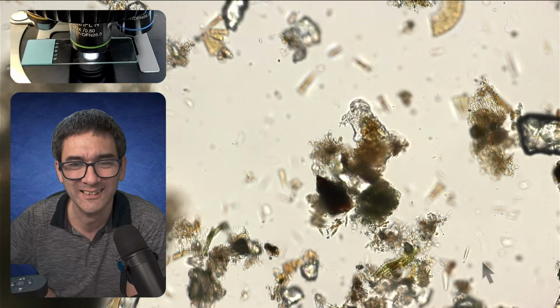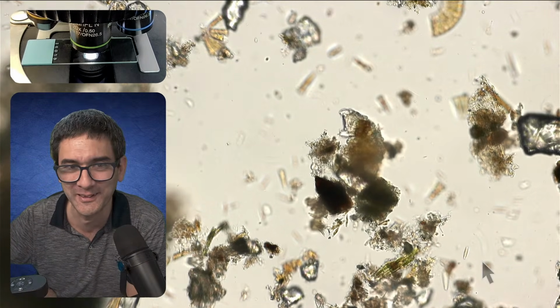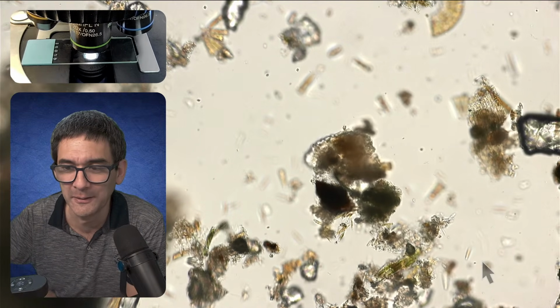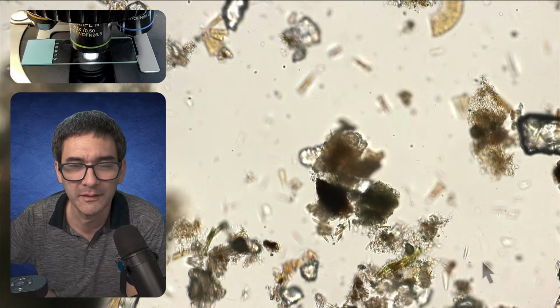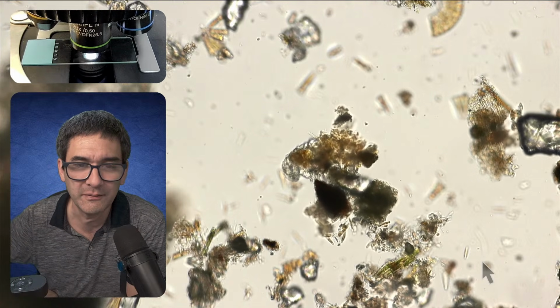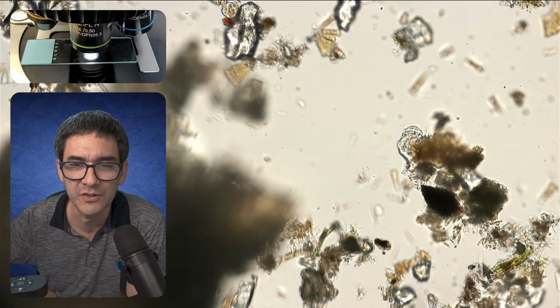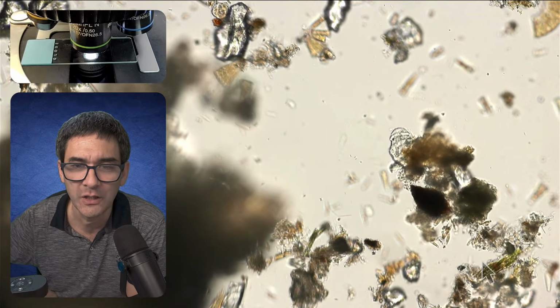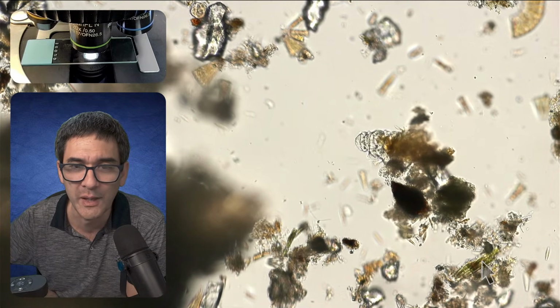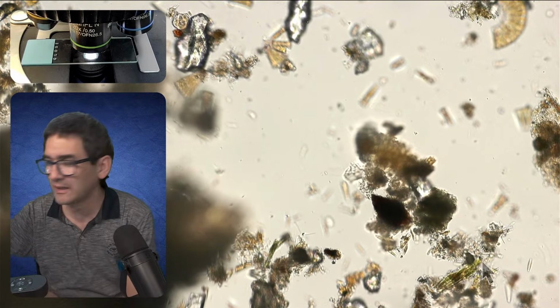It's a rite of passage, basically. Once you've managed to find those, then yeah, they're called moss piglets as well, because they're commonly found in moss. And they are, of course, surprisingly dry resistant. So that means they can actually survive periods of dryness. But this one over here, because the moss was always wet, I'm kind of happy that I'm getting it separated now.